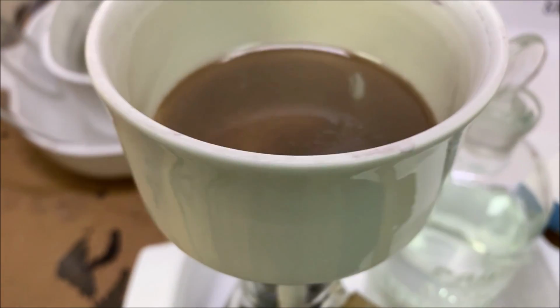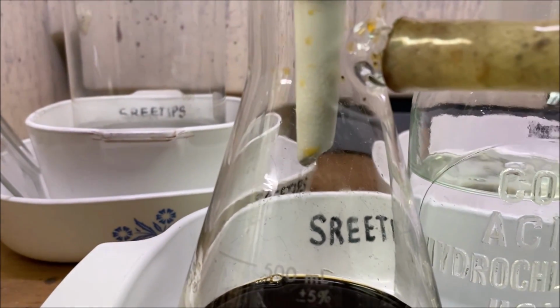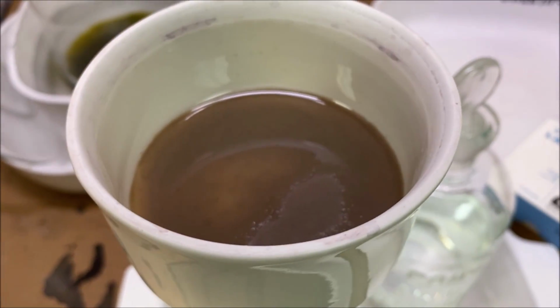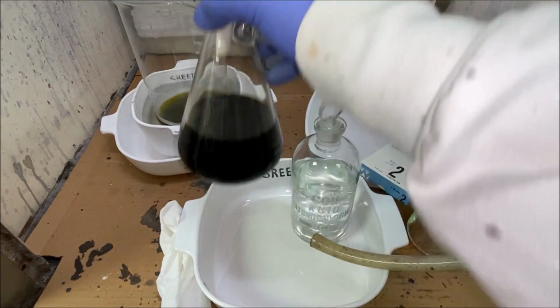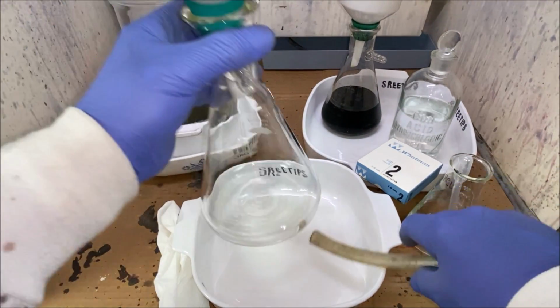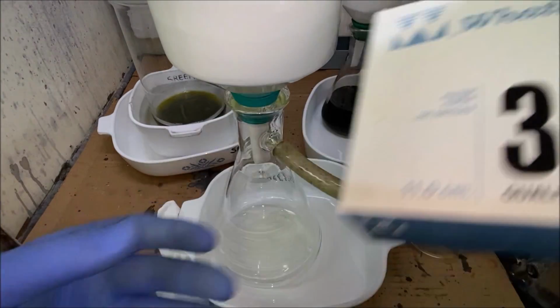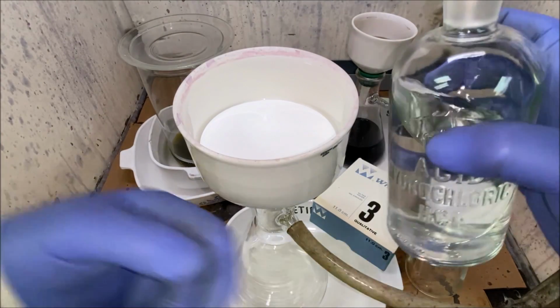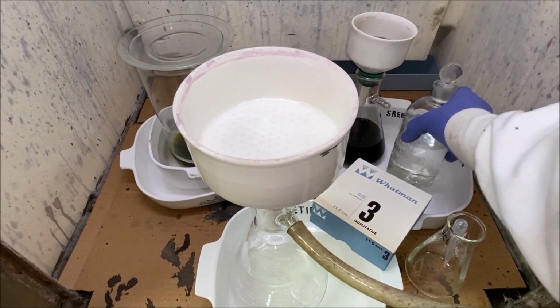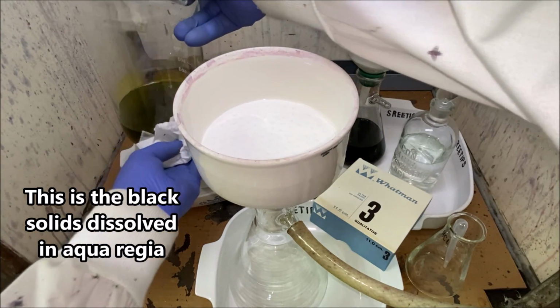I've rinsed the filter over and over with some hydrochloric acid. And you can see now the filtrate is coming down through there. It's clear, so it's safe to conclude that we've rinsed all of the precious metals solution out of our filter. Wet the filter with some hydrochloric acid. Okay, here we go. We're going to take our other solution now and get this filtered.